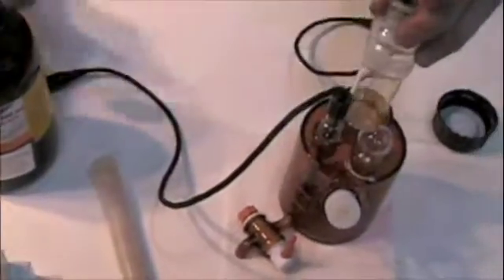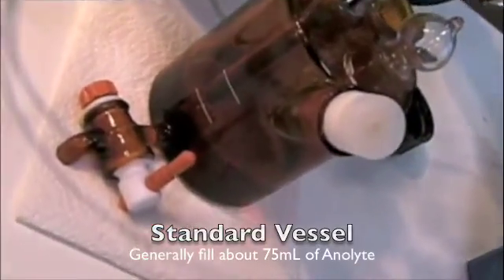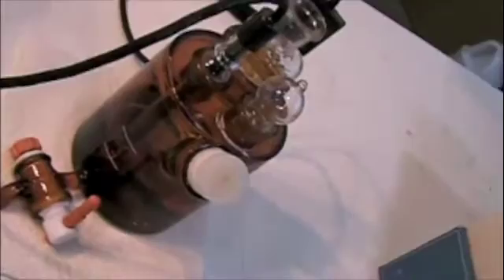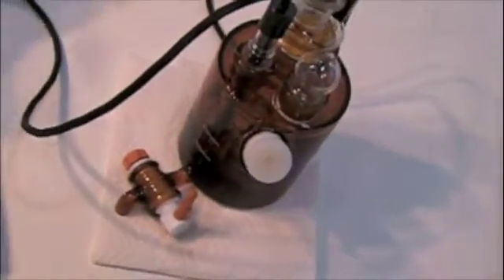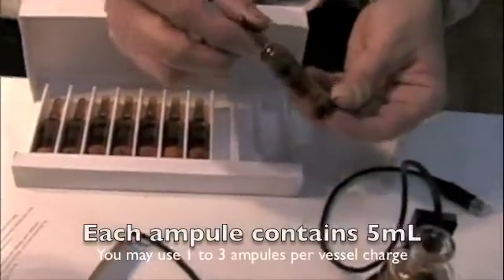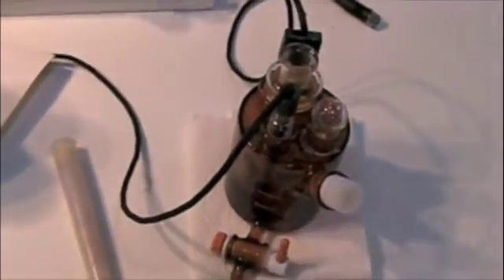To charge your vessel, we're going to introduce the reagent into the vessel up to the first line. In the case of the generator electrode, we would use the CG here in these ampules. We pop the top and pour that into the top of the generator electrode. This one currently has some in it, so we're okay.